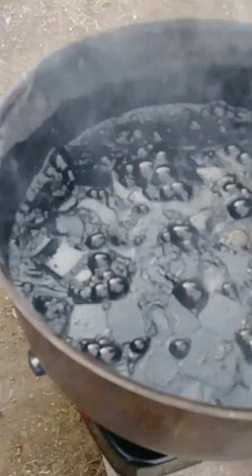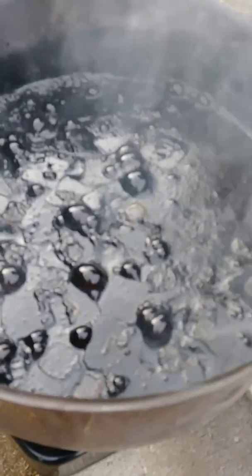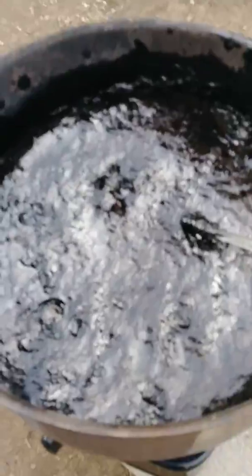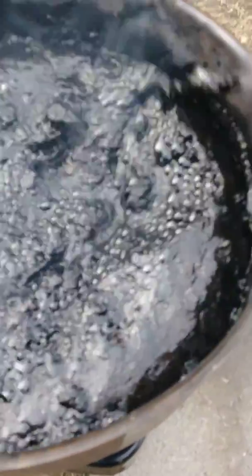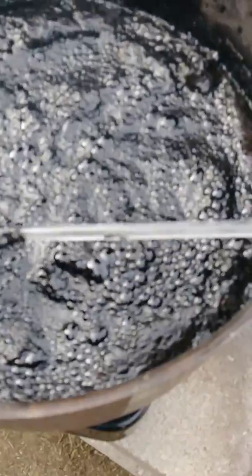A little bit of chip still floating that needs to be dissolved completely — say another five to ten minutes and this will be done. This has been on now for 30 minutes; it is complete. It has a thick froth on top.